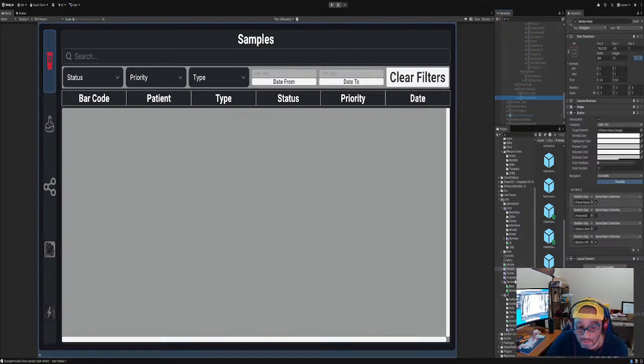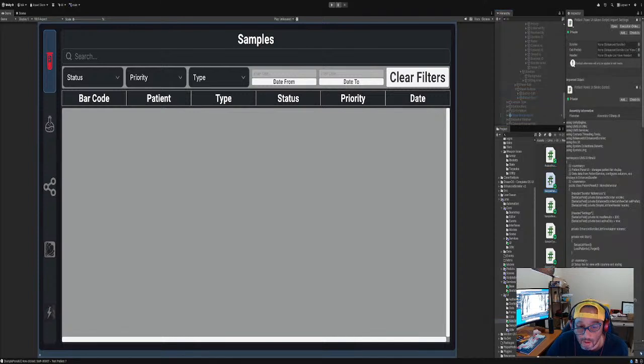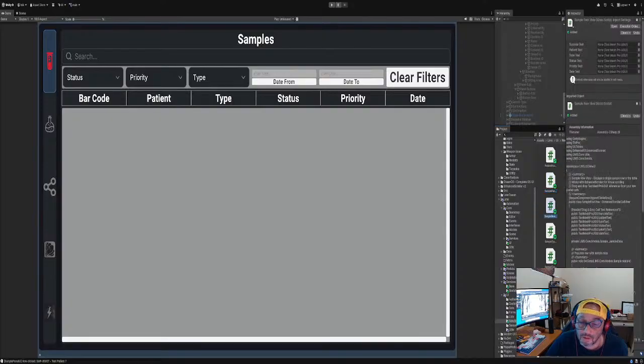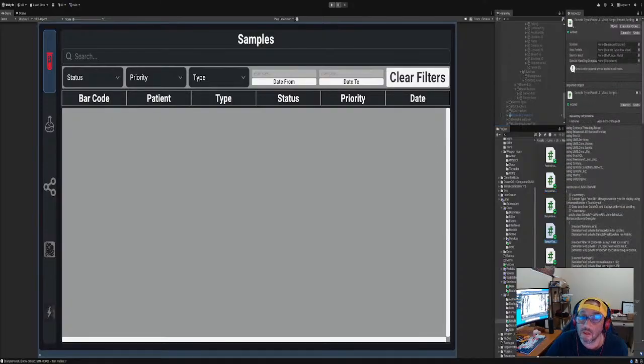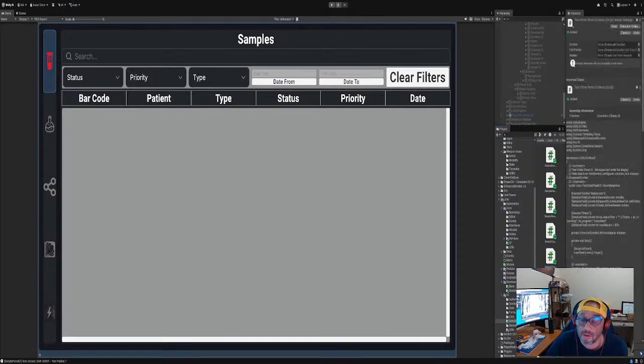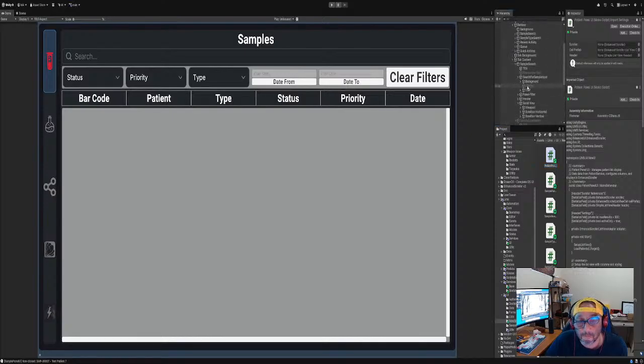All right. That's nice. Whatever. New UI. New sample panel. Pre-roll date, no, that's not it. Nope, that's not it. Sample type, no, that's not it. Row view, no. Test order. Okay. So now we have this, and we want separate scripts for all these, right?